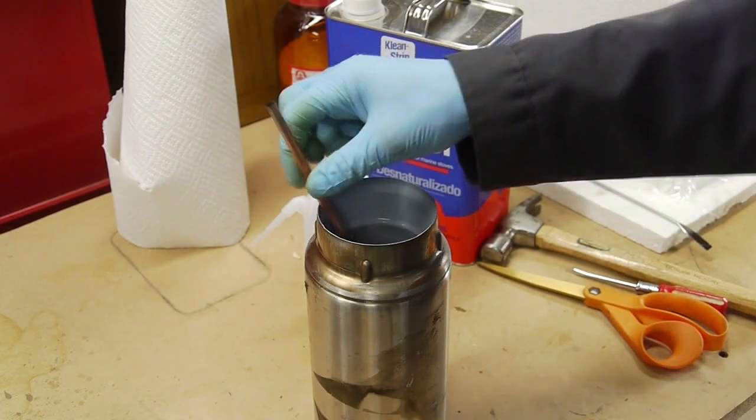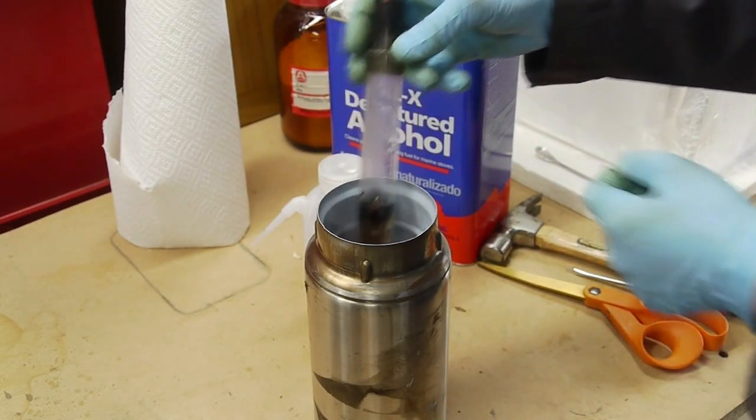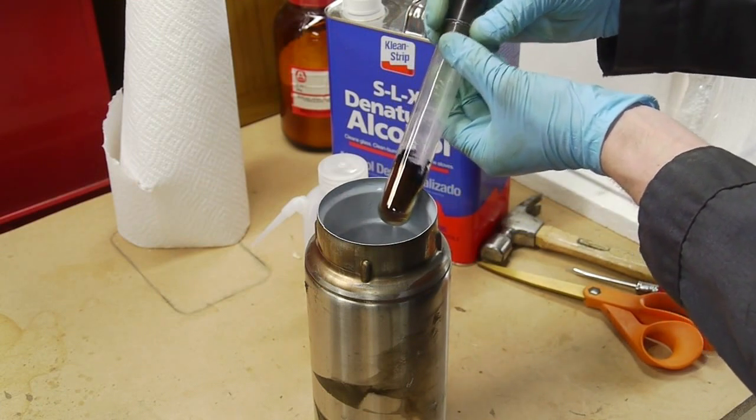Hey everyone, I've got a quick chemical reaction to show you. This is lithium metal dissolved in anhydrous ammonia.